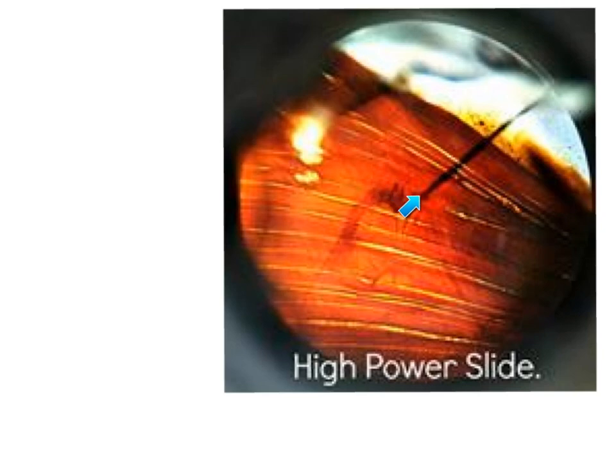At the area of contact between the nerve and the muscle, we have this nerve ending, which is called the motor end plate. But take care, it is an easy slide, but most of you forget to mention the special stain, which is silver. So it is very important to mention the stain, which is AG or silver.